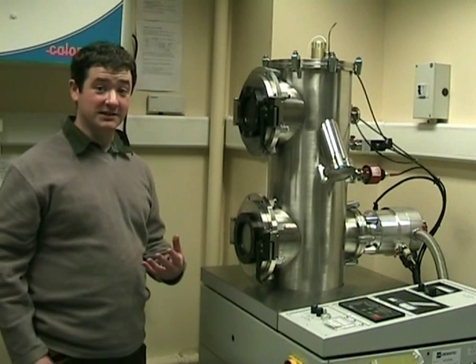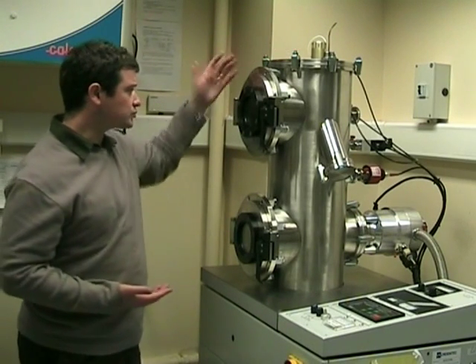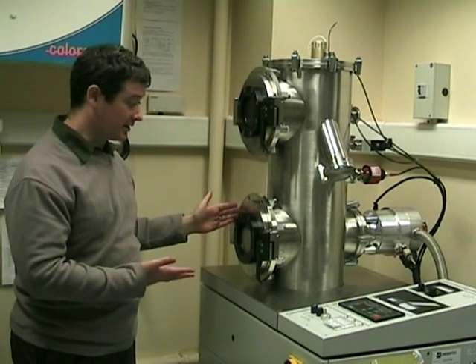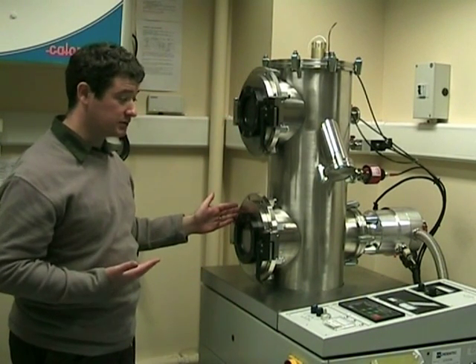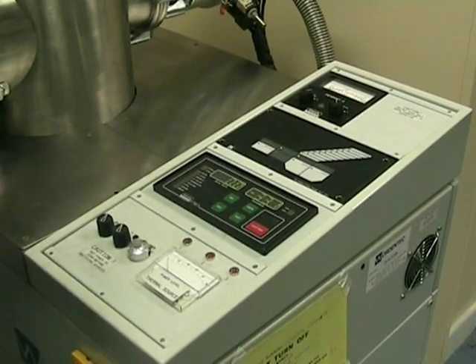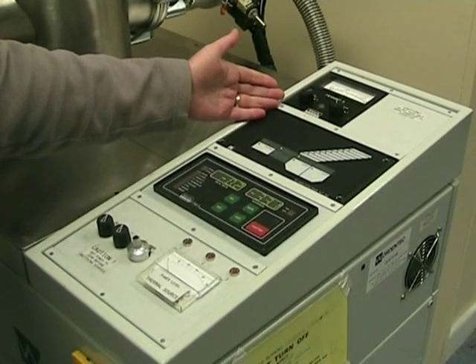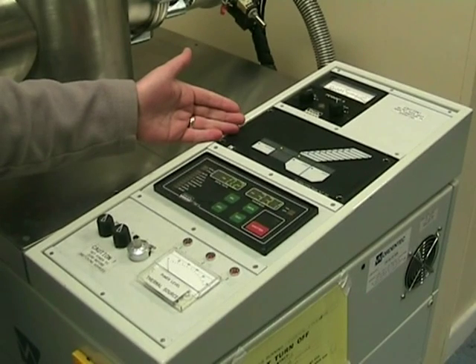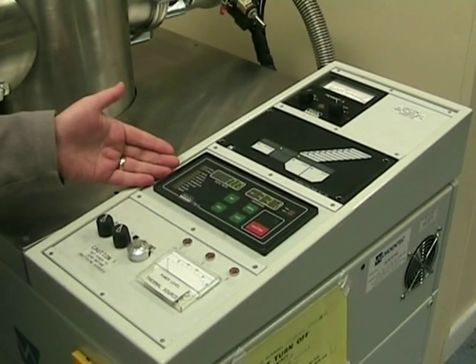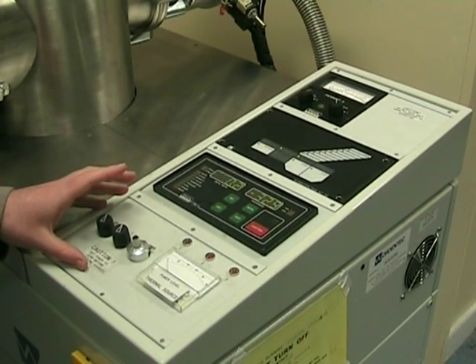Our evaporator consists of a turntable to rotate the samples, doors to put samples in, and doors to the crucible. It also consists of a penning gauge used to measure the pressure, indicator light and controls for the pumps, the rate monitor control unit, and the crucible power supply.